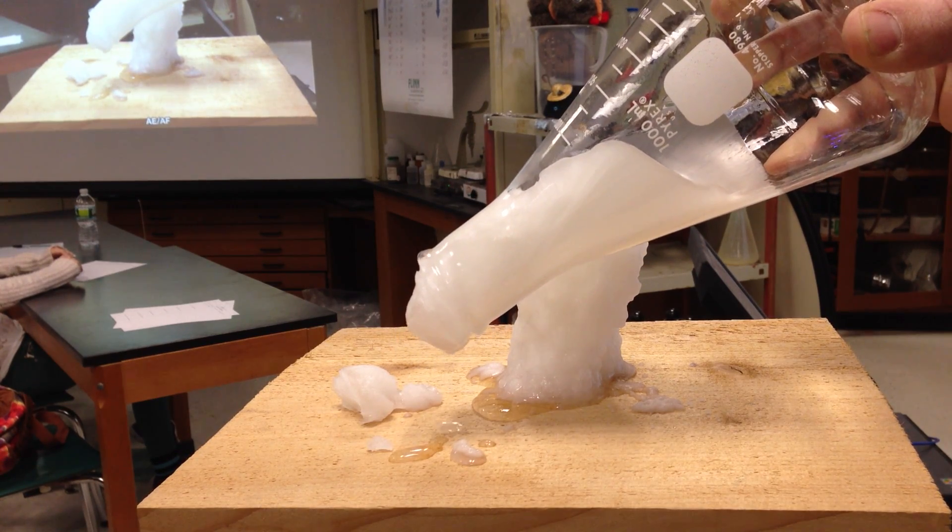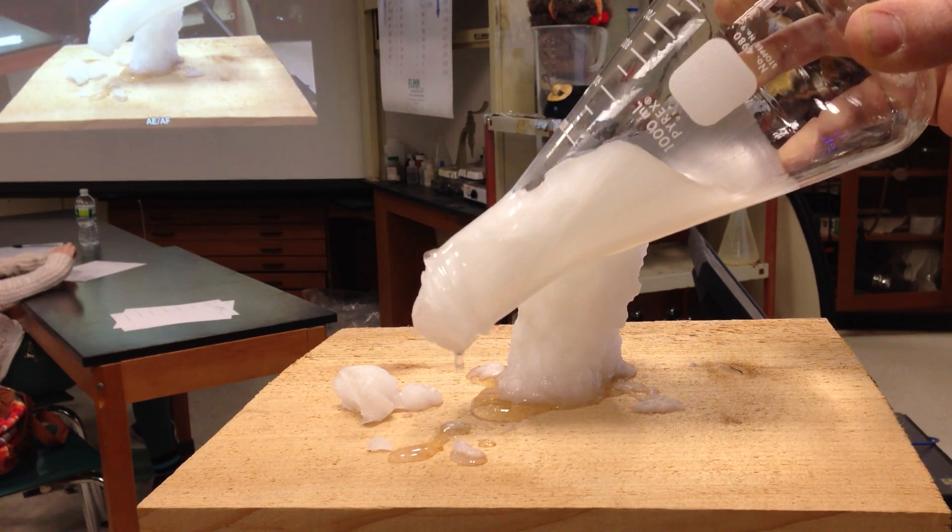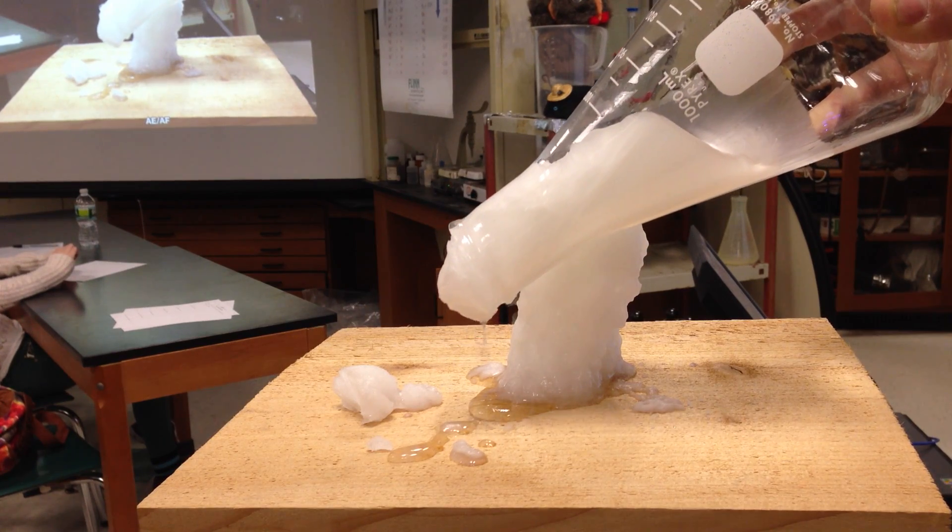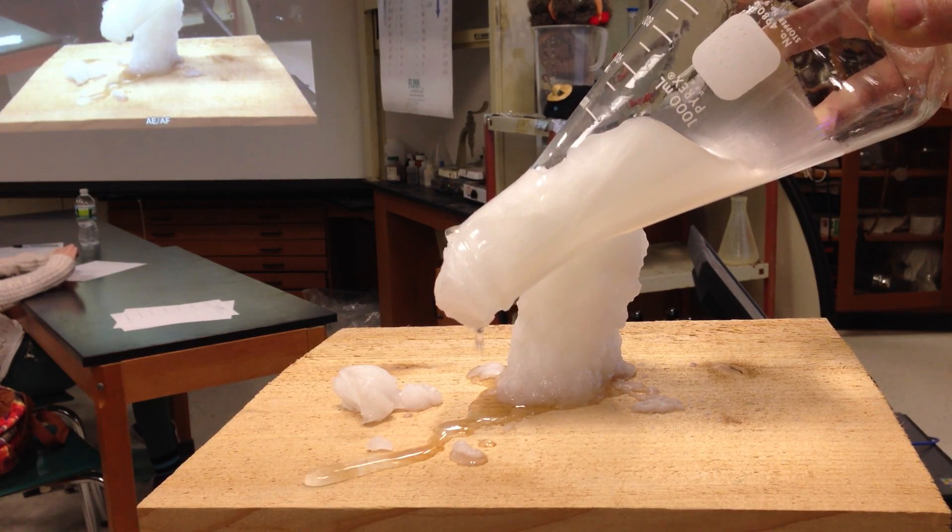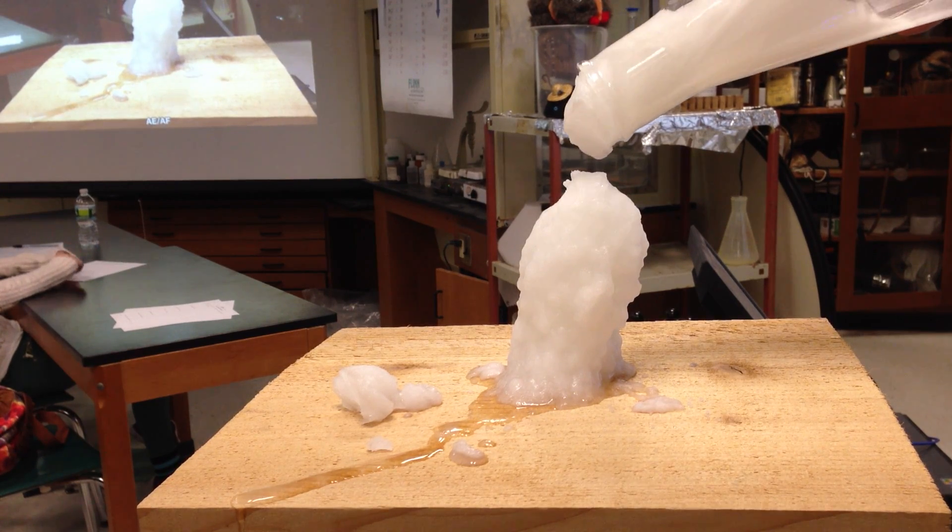Now, there's still some water. You can see it dripping. Now, you can see that there's very little water in this solution. It looked like it was clear, right? So that little bit of water is able to dissolve this.